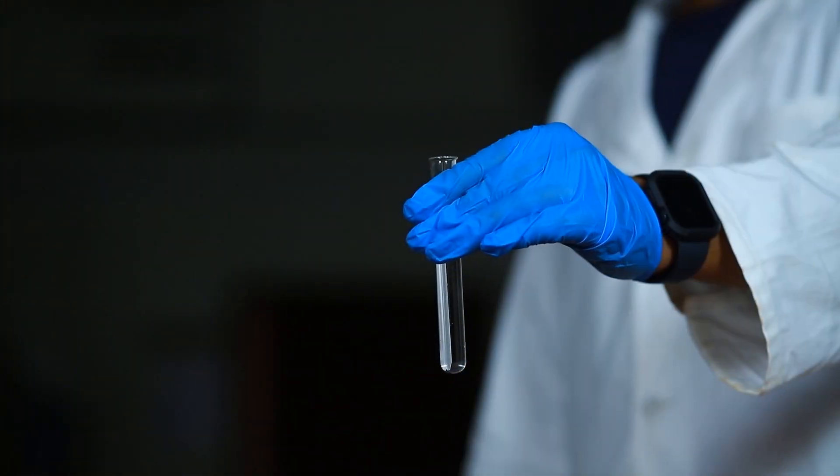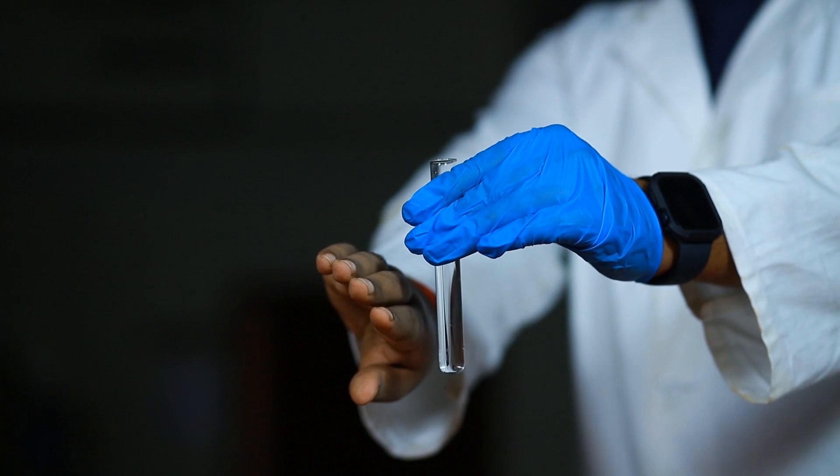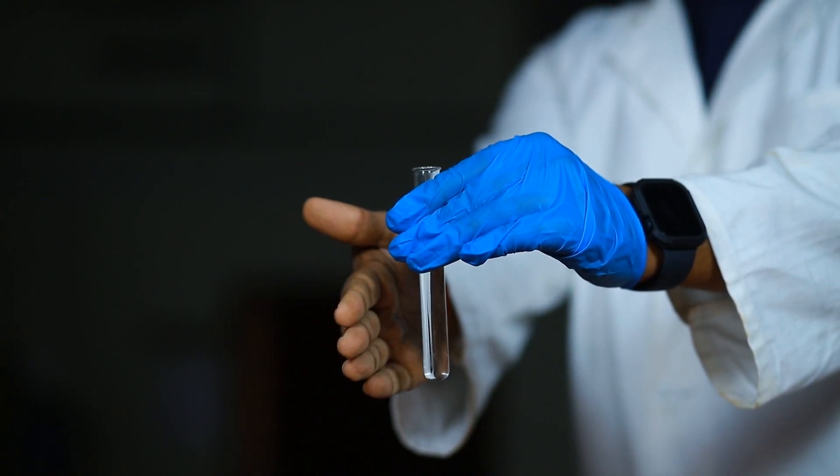Touch the test tube and feel the temperature after complete addition of acid. You find it warm.